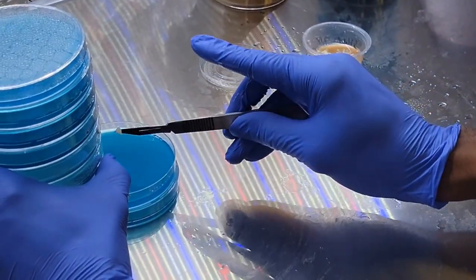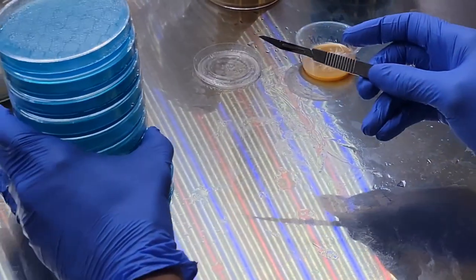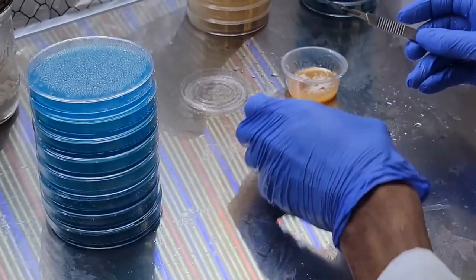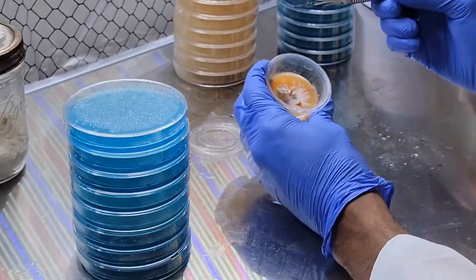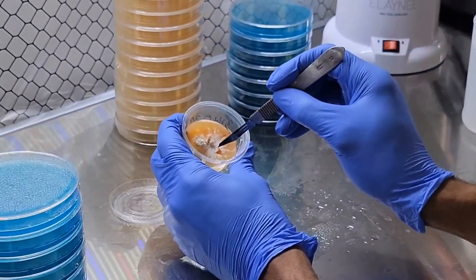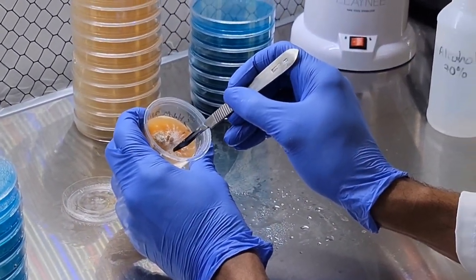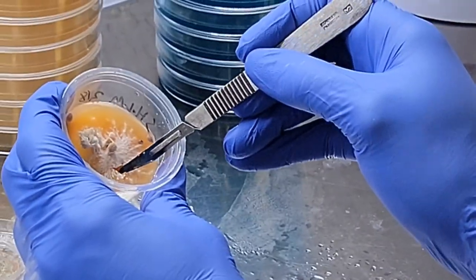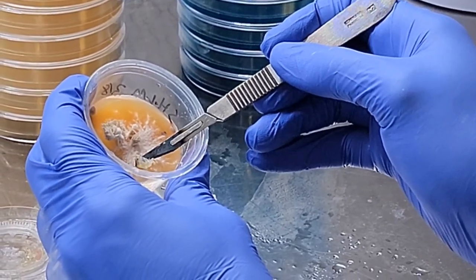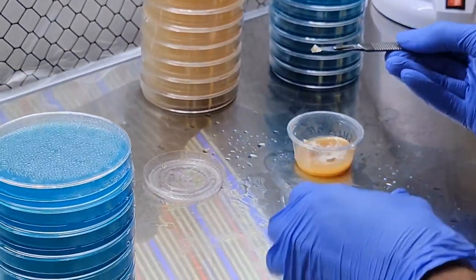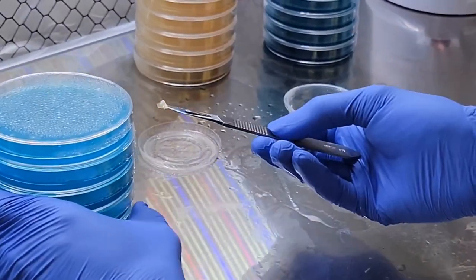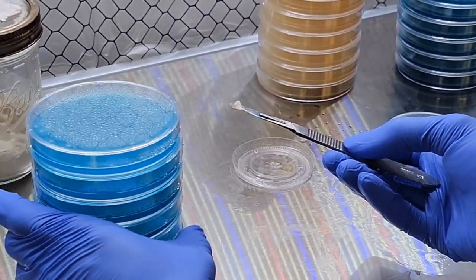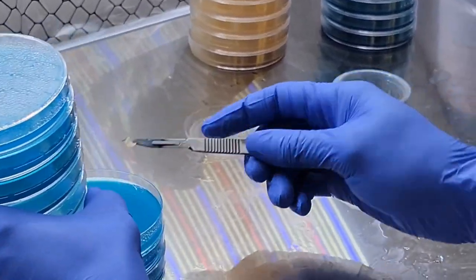I'm just gonna tap this off. And this is why you take as many samples—take more samples than you think you need. Because there have been so many times when I thought I took enough and it just wasn't. You just have to increase your chances of success.